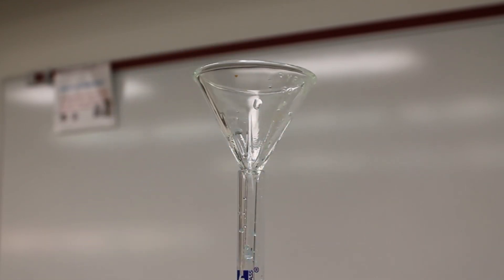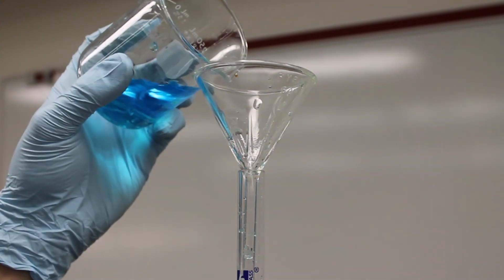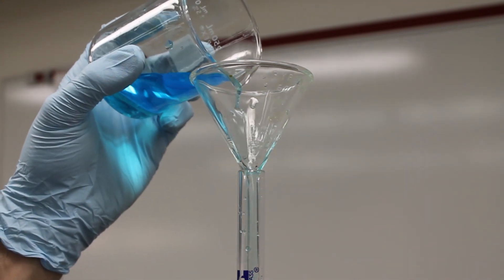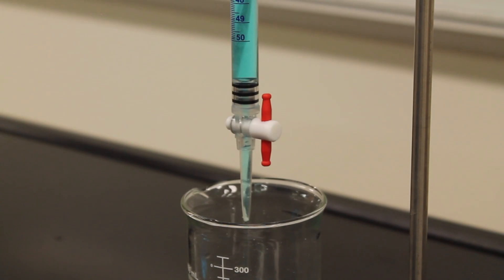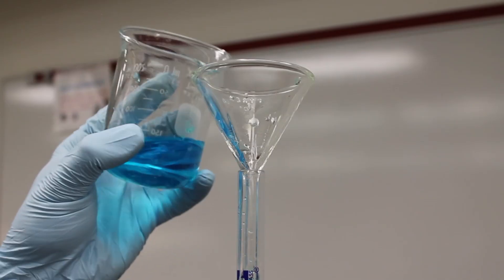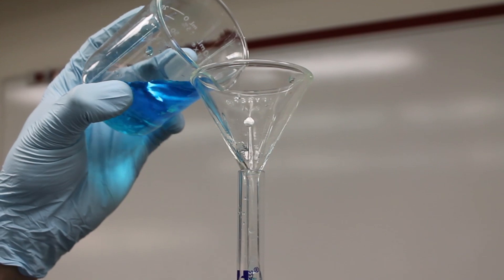Now you are going to do the same procedure with the liquid you're putting into the burette. Make sure you wash the sides of the burette with this liquid as well. Again this needs to be done a minimum of three times as well.